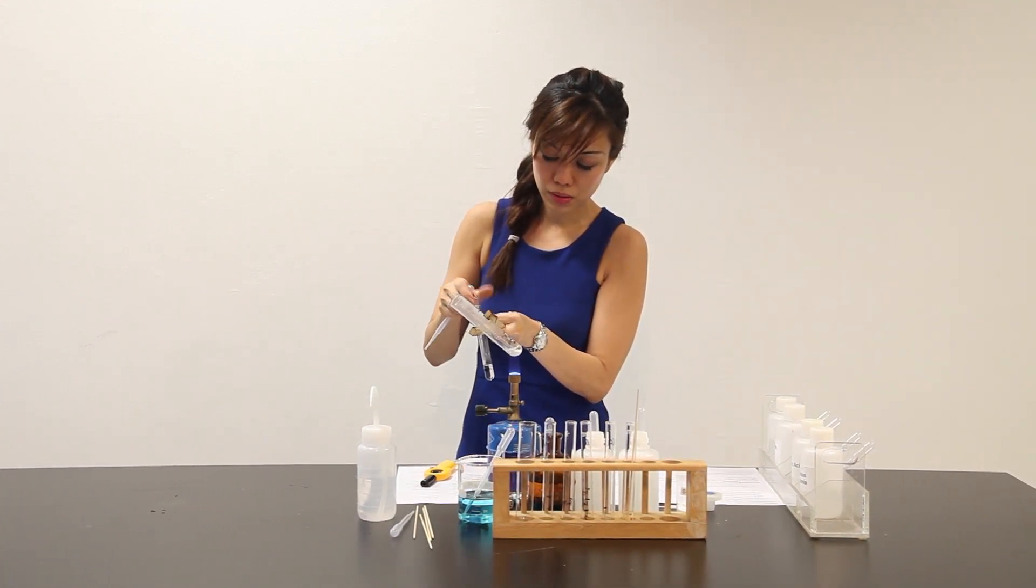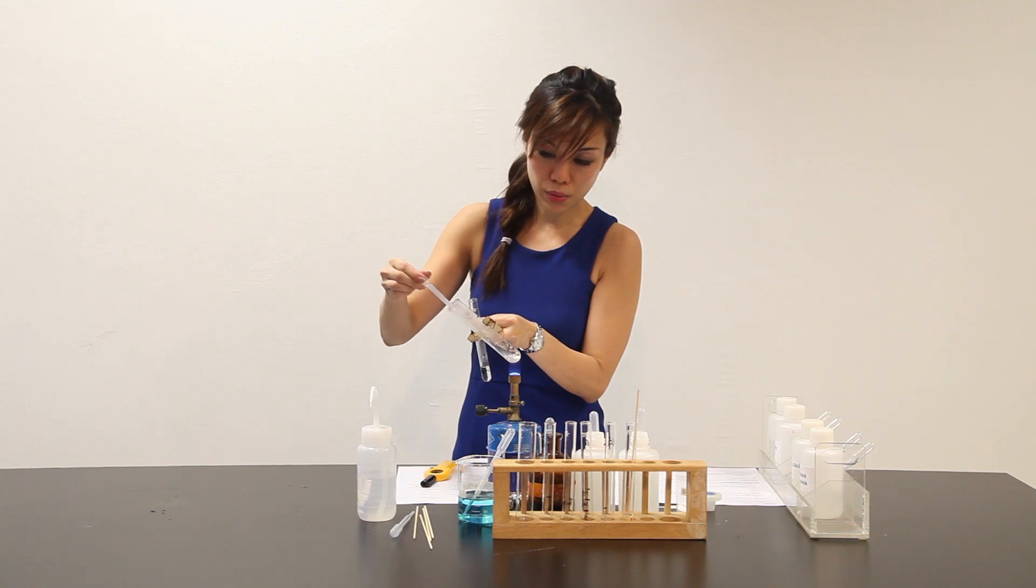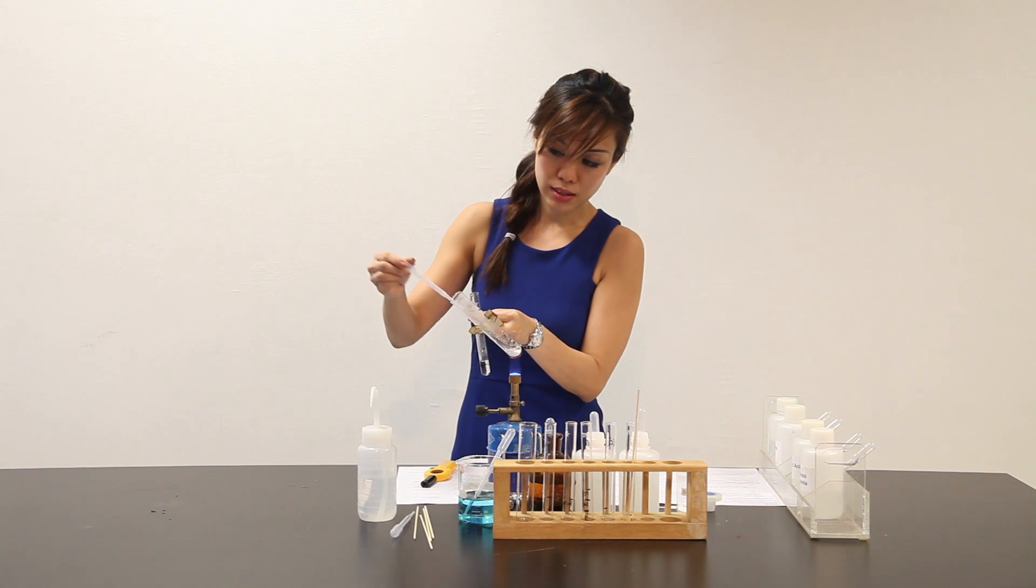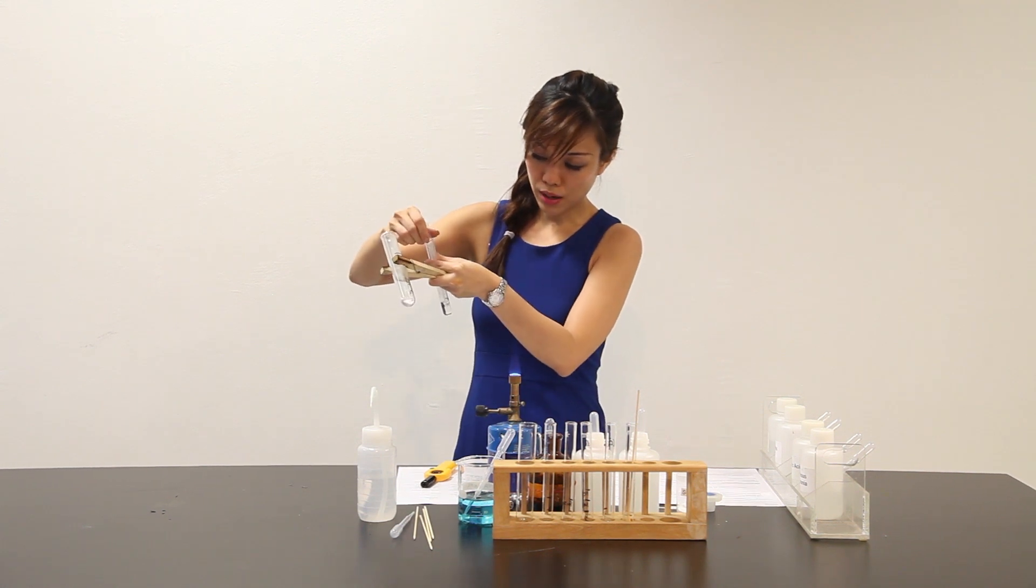Heat some more. Press, release, go in. You count about three times. One thousand, two thousand, three thousand. Take out. Put through here. Bubble again.